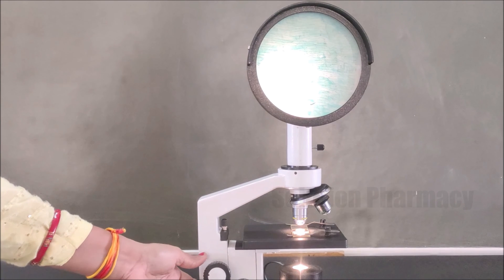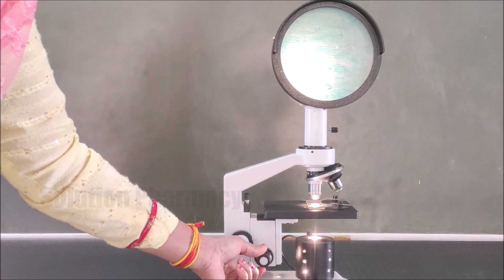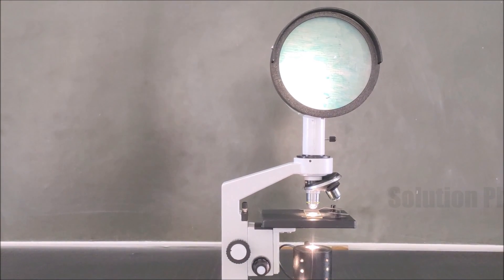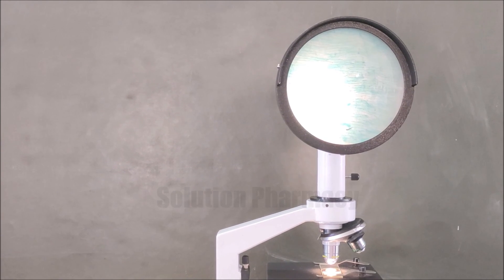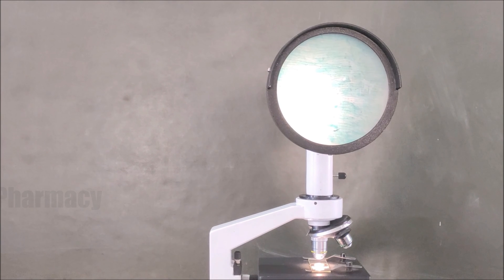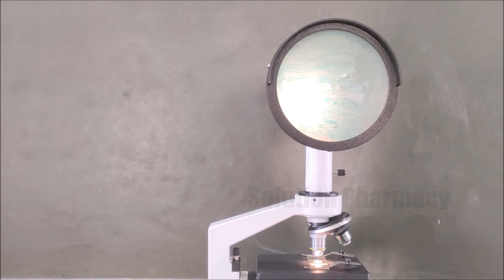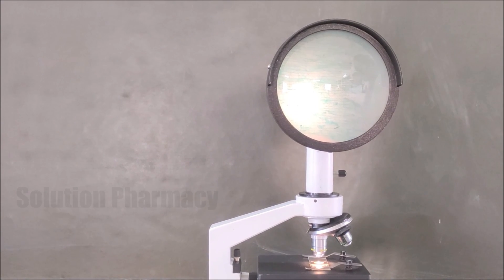First use the coarse adjustment knob to rough-focus the specimen on the screen. Then to view the magnified image more clearly and sharply, rotate the fine adjustment knob until we observe a fine, clear, and sharp image. Note that in the video, intense light appears on one side of the screen due to camera reflection from the mobile recording — but directly we are observing a clear and sharp image of the tissue on the screen without this light disturbance.